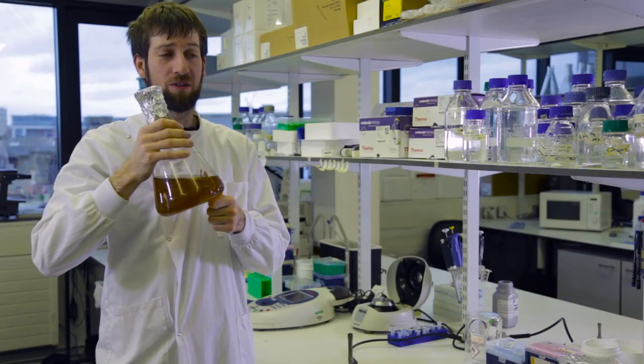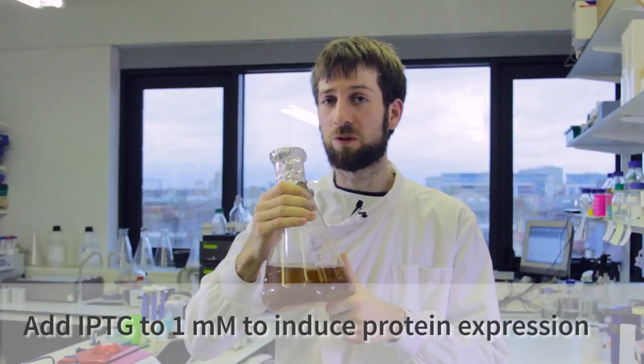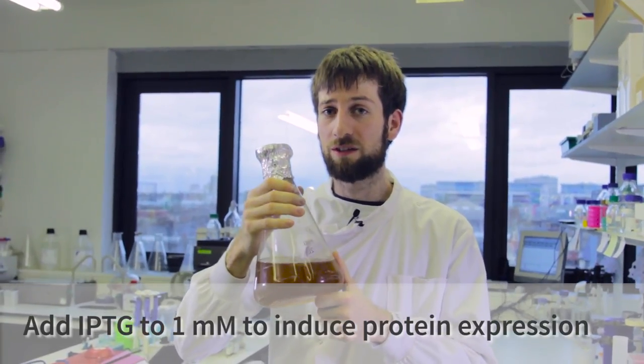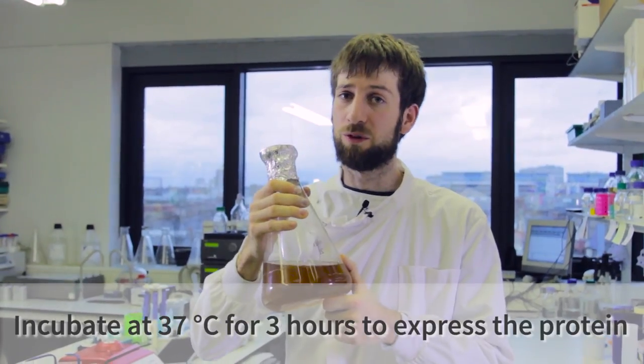I've now taken the cells back from the 37 degree room, and as you can see the cell density has increased. This is the point at which I will add my IPTG to induce the expression of my protein. I will then take the cells back to the 37 degree room to incubate and grow for another three hours to produce my protein.